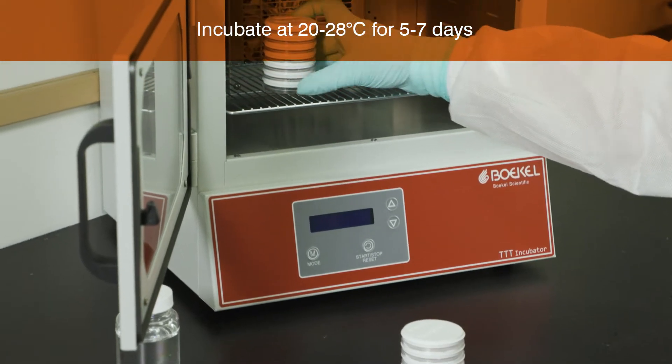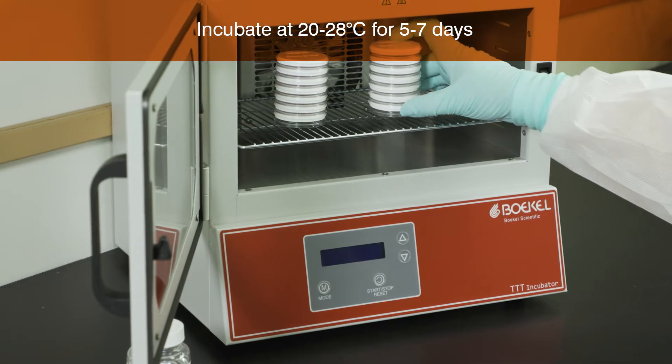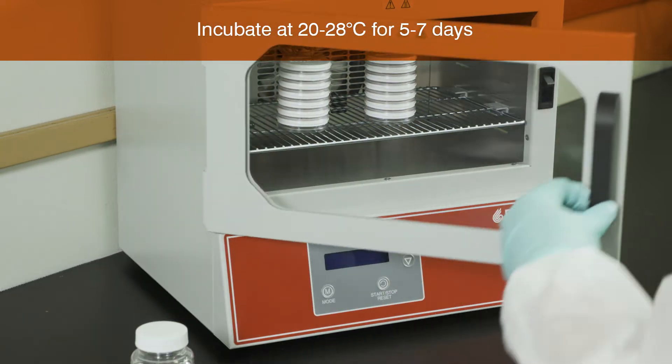Incubate the plate, white lid side up, at 20 to 28 degrees centigrade for five to seven days.